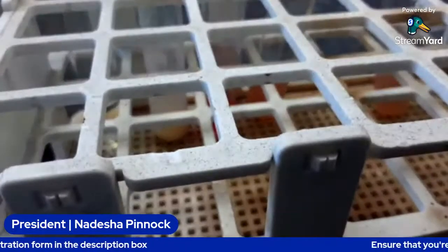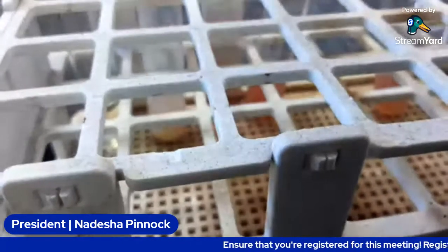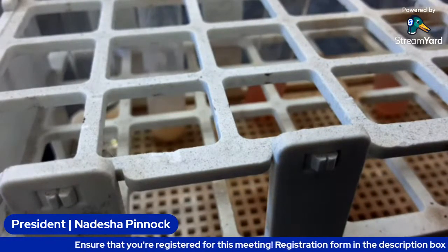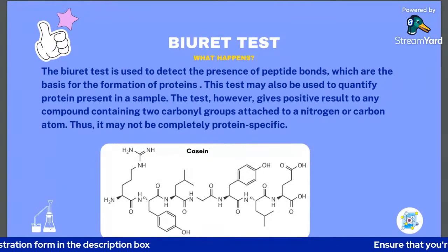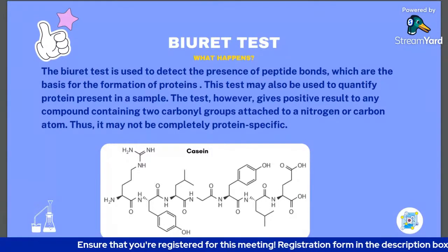Yes, we have some syrup. Let me label it. This is the syrup. This is the fruit juice.